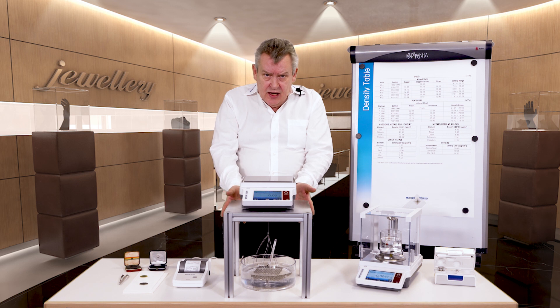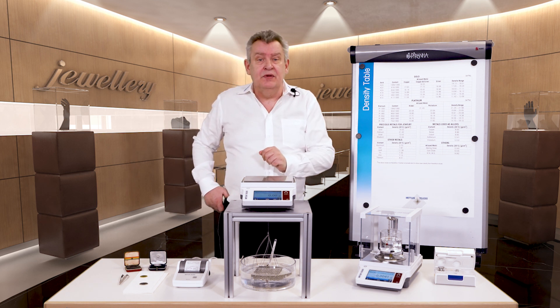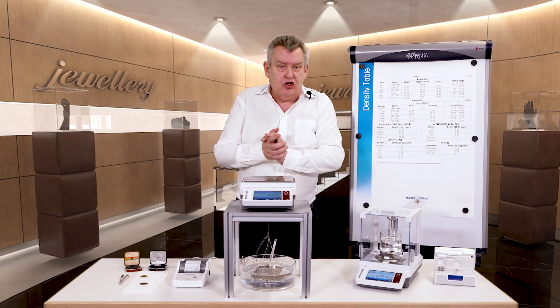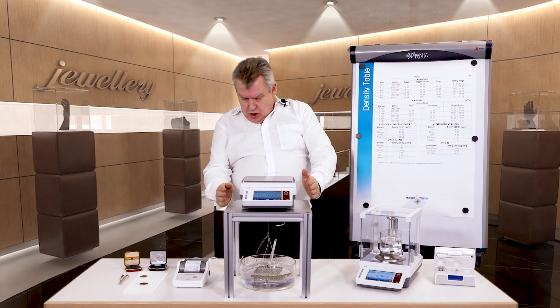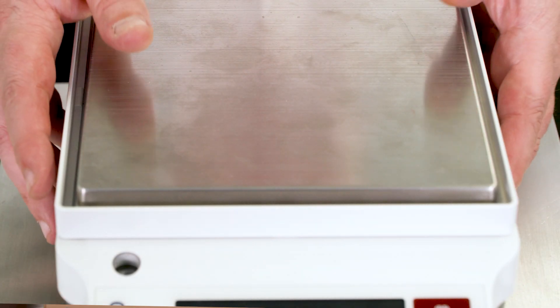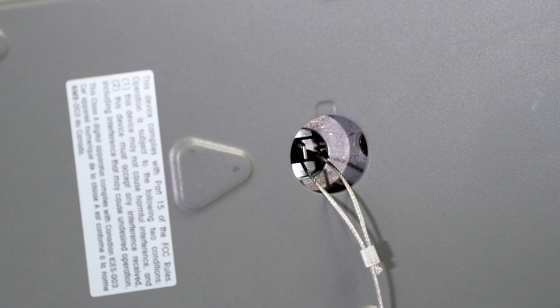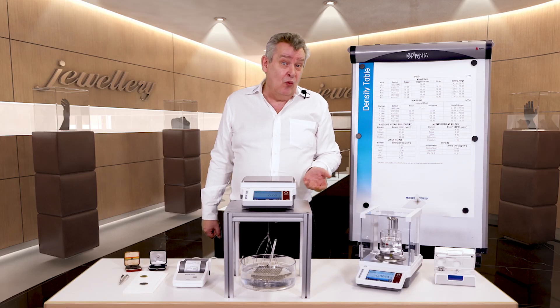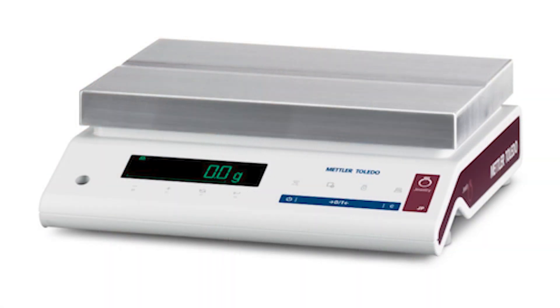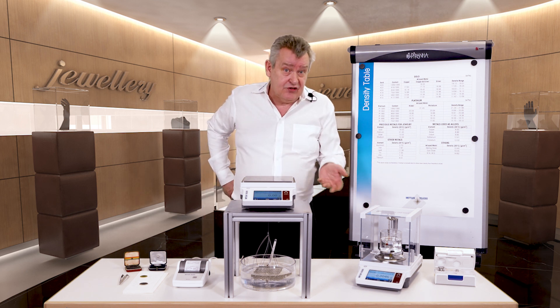Take a look at this construction here in front of me — something we made earlier to perform purity measurements. You can see the Jet Balance on top of this table construction, and underneath it a container of liquid. There's a hook on the underside of the balance used for under-balance weighing. All Mettler Toledo balances have this hook, and it means that with our 32 kilogram large precision balances you can determine the purity of gold and silver bars using this technique.